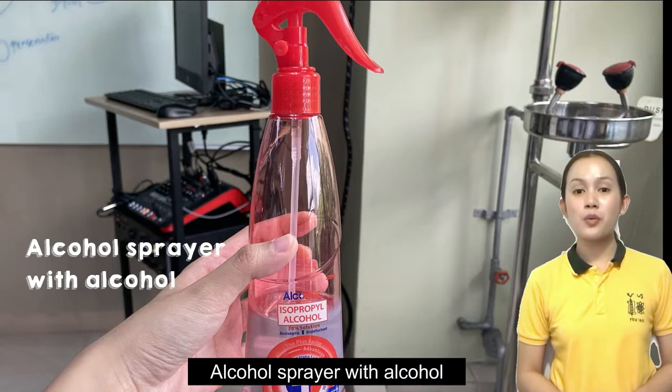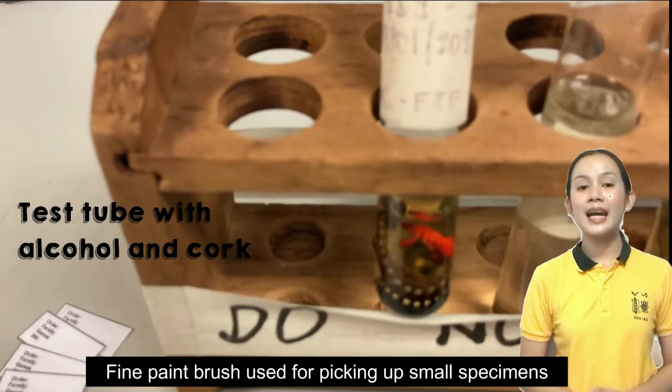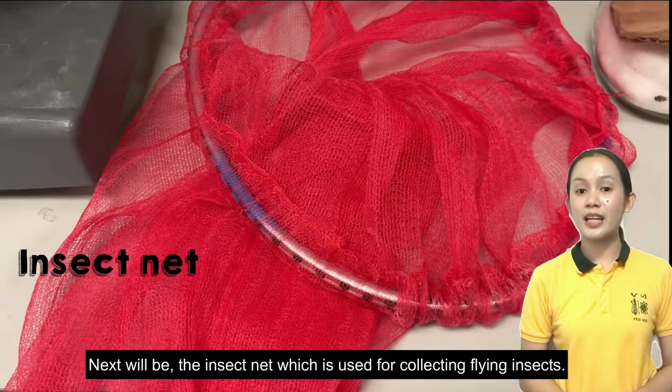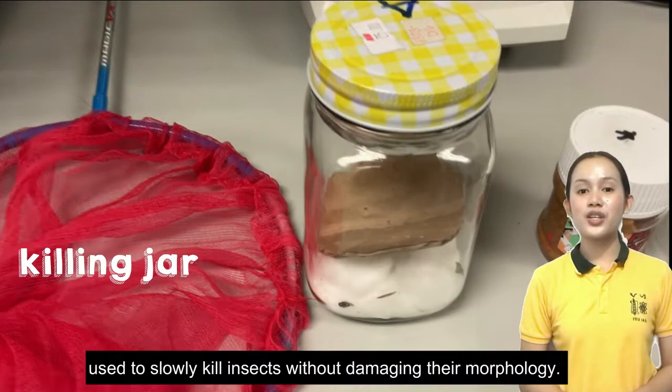Next will be the alcohol sprayer with alcohol, used to slowly kill insects and impede their movement. Next will be the test tubes with alcohol and cork — this is where the specimens are initially stored after cleaning or collection. Next, we have the fine paintbrush used for picking up small specimens. Next will be the insect net, which is used for collecting flying insects. This insect net is made from a badminton racket sewn with a nylon net along the circumference of its head.